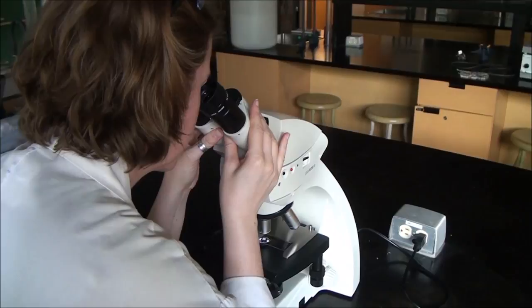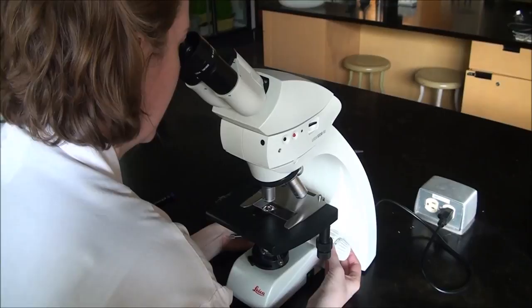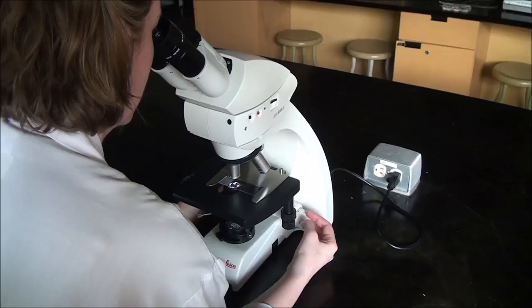Looking through my ocular lenses, I'm now going to come back to my coarse and fine focus, and while looking through the oculars, I'm going to slowly lower the stage until that felt marker comes into focus.